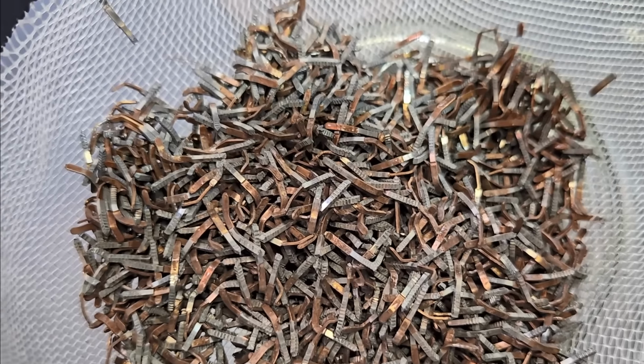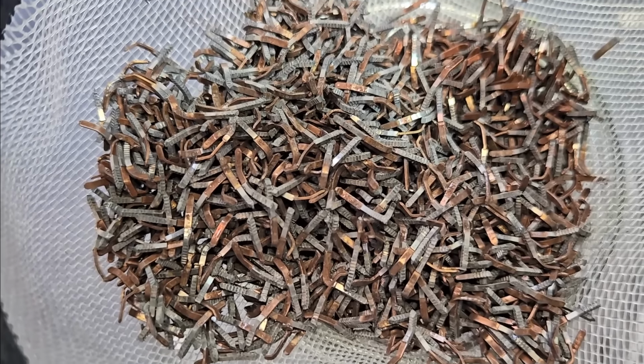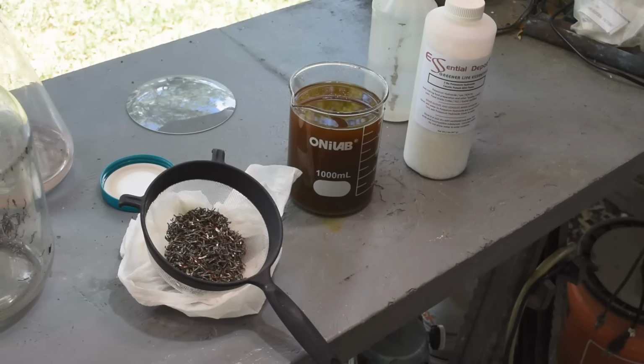Yeah, there's just a little bit of gold here and there, it looks like. It looks like we've got the vast bulk of it off. Yeah, so that remaining little bit of gold on there could be my fault for not cleaning them first. People yell at me in the comments all the time that I need to clean stuff first before I use a gold leach on it. And they're right, and I intended to do it this time, but it completely slipped my mind somehow.